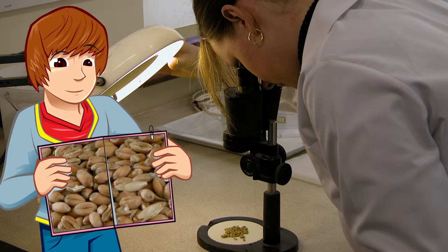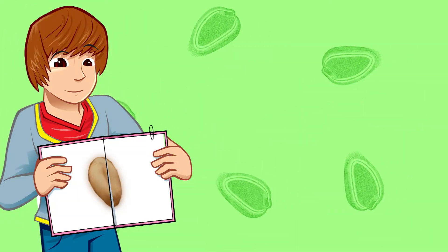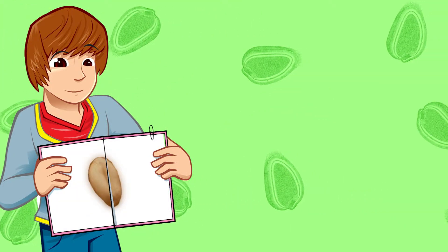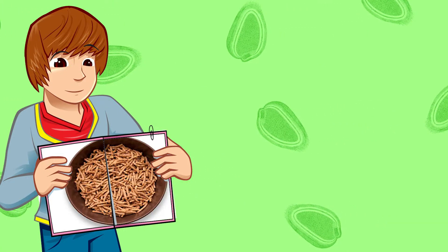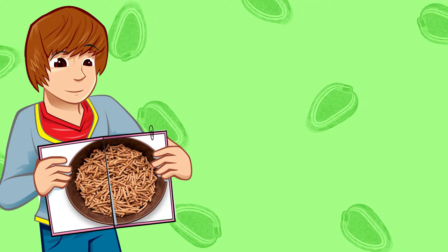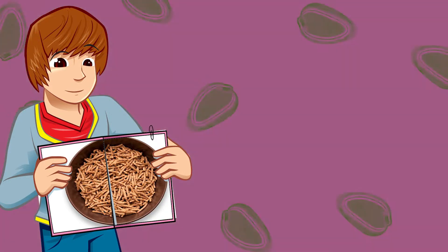Now if I break open this grain we can get a closer look. Firstly I can see that the outside layer looks really thick and tough under the microscope. This is the bran layer. When you eat bran cereals this is the bit you're eating. It's tough for a reason — it's like a skin which protects the inner seed from attack.